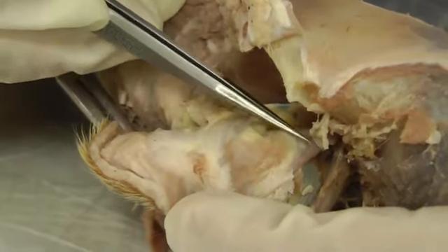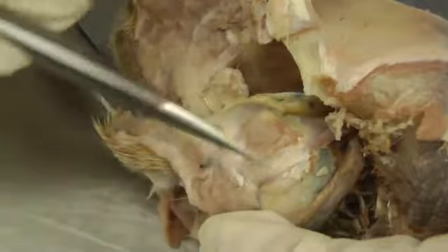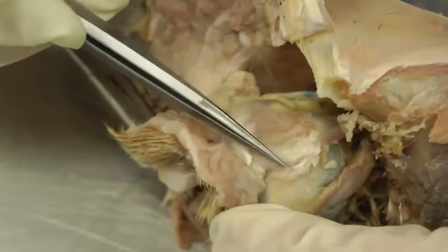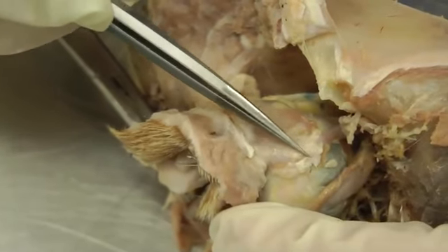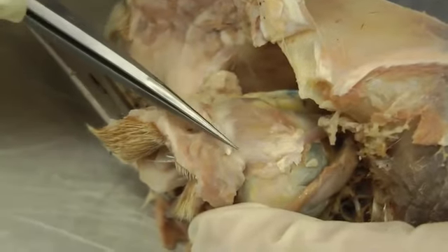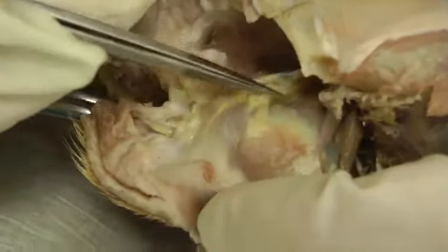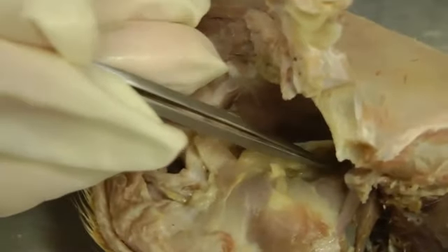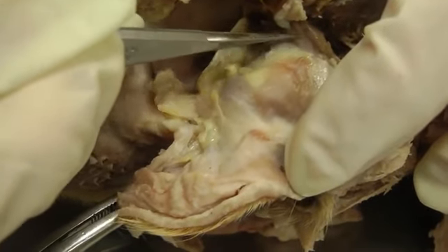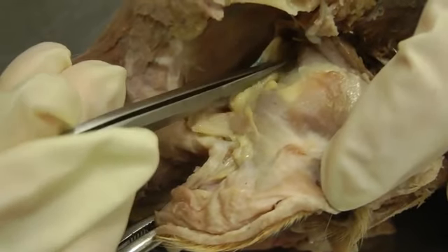And then if you roll this out even further, we'll get a look at the dorsal oblique. So dorsal oblique will be this one right here. And then that's going through that little cartilaginous plaque, the trochlea. So that's going to be right here. And again, it's more by feeling it. You palpate it, and it's hard. You can tell where that trochlea is. So that dorsal oblique passes through that. And then if we go a little more to the side here, we have a medial rectus muscle right there. So that dorsal oblique going across there, and then the medial rectus muscle right here.